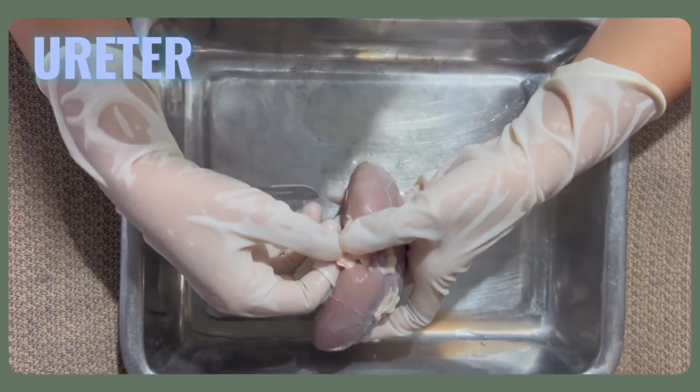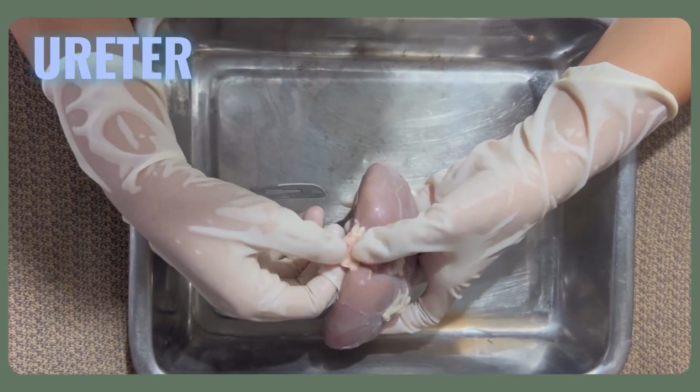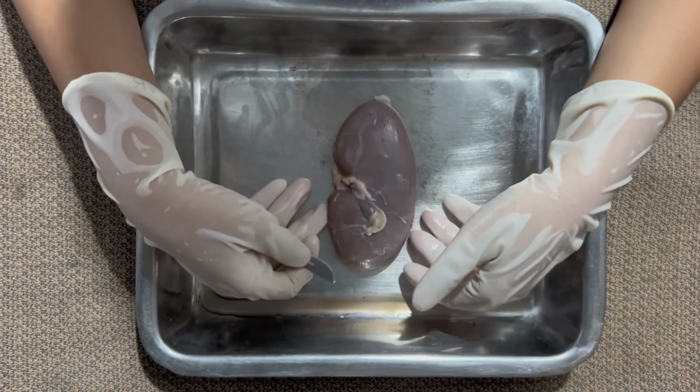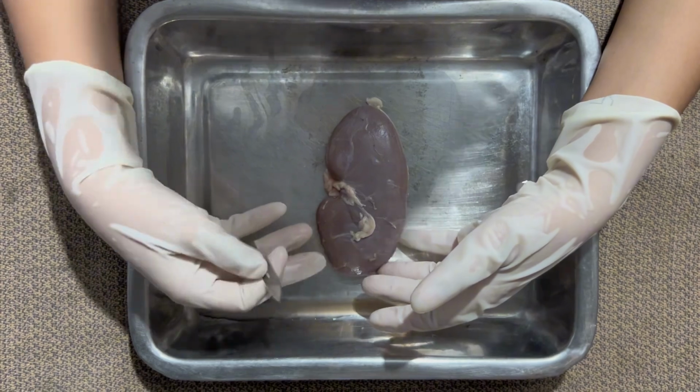The ureter is a tube that carries the urine from the kidneys to the bladder for storage and eventual elimination from the body. After identifying the external parts and their function, we are now going to dissect our kidney.